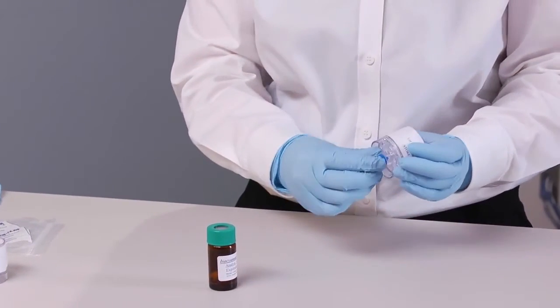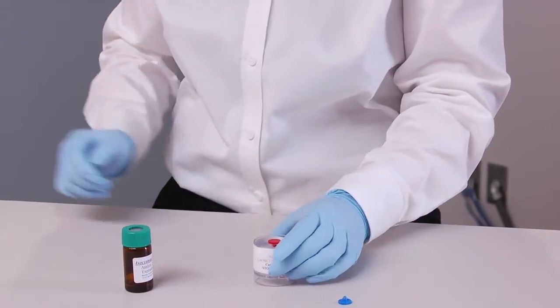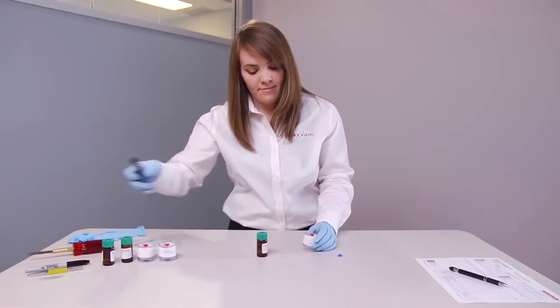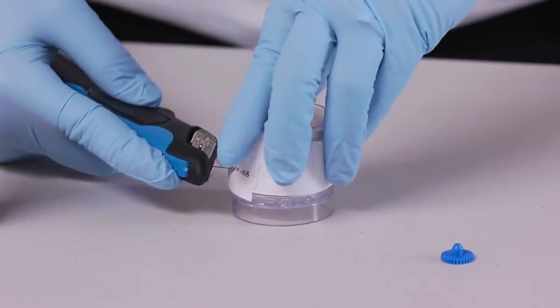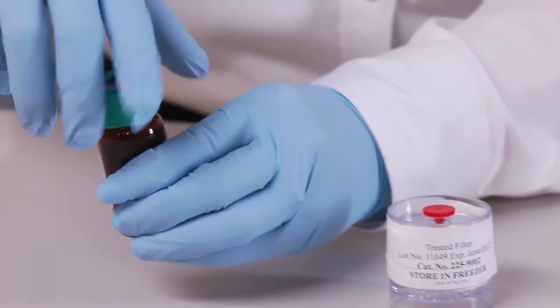Remove the plug from the cassette outlet and cut the cassette tape at the bottom joint with a cutting tool or peel off the tape. Open the vial.